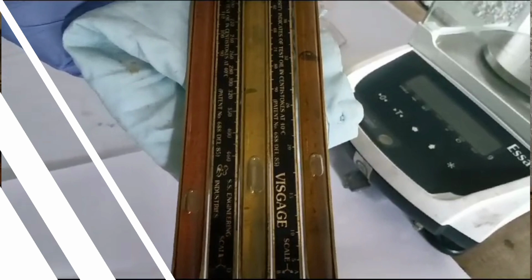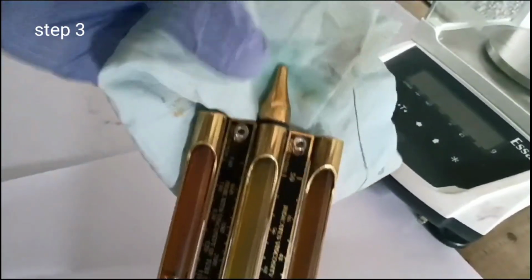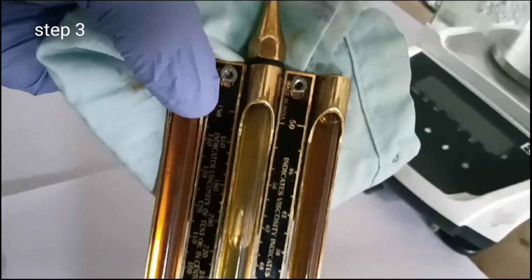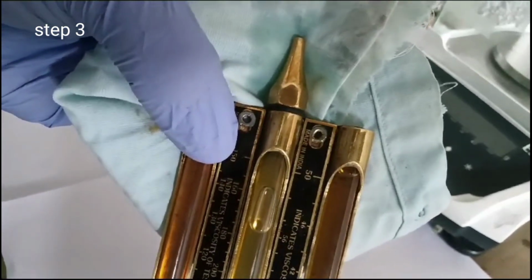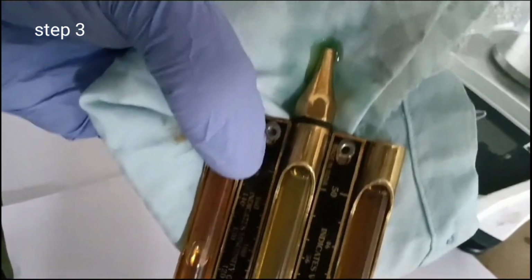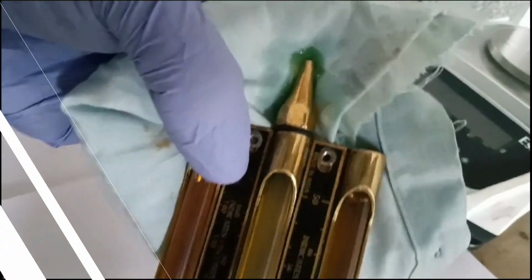If an air bubble appears in the test tube, invert the instrument so that the nozzle points up. When the air bubble has reached the nozzle, discharge the air by pushing the plunger. Again, insert the nozzle in oil and completely fill the test tube with oil free of air bubbles.